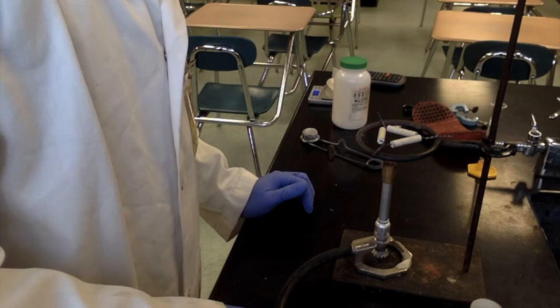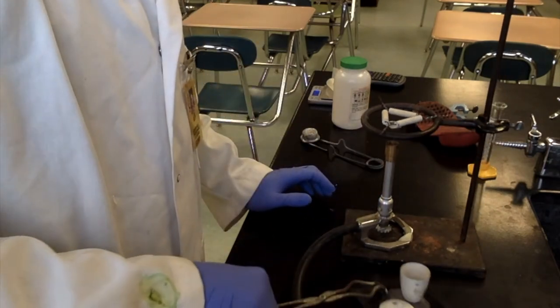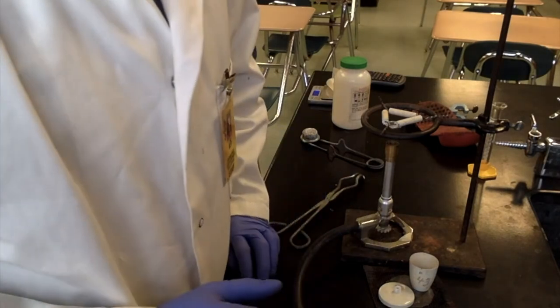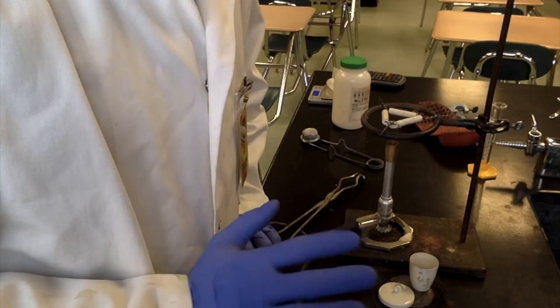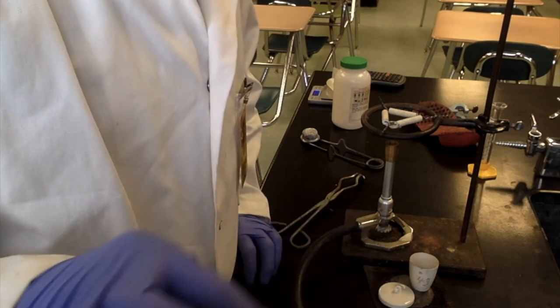And now you definitely don't want to touch it. So I'm using the crucible tongs to move it around. And I'm putting it not on the countertop directly, but on the ceramic mat for cooling. And we'll leave that there. It's got to cool for about five minutes. Otherwise the mass will be totally wrong. So we'll come back after it's cooled off.